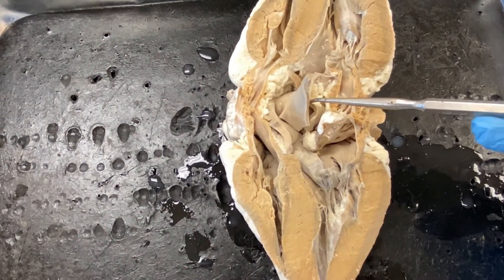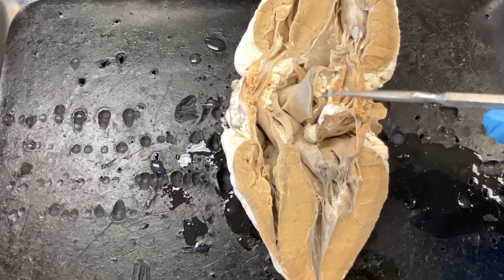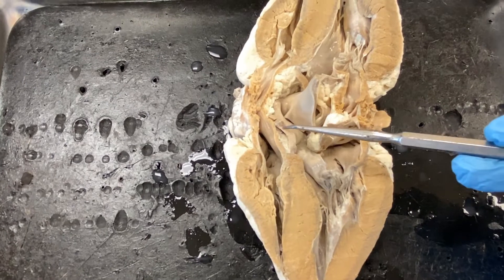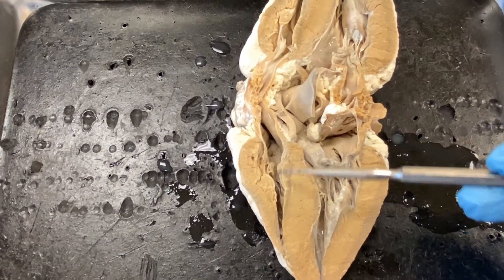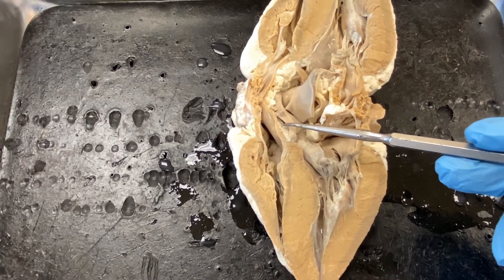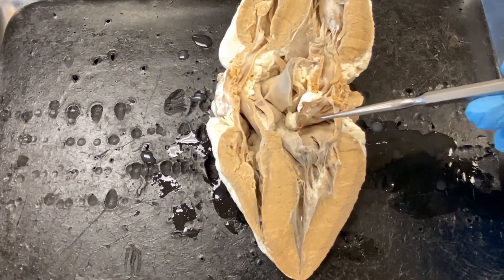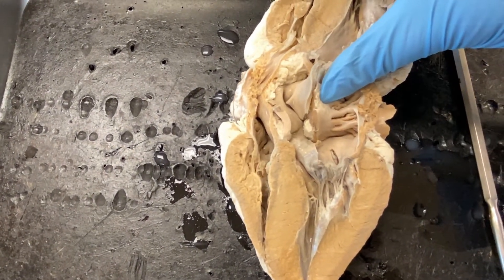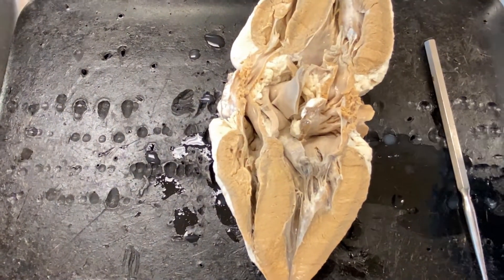At the junction of the aorta and the left ventricle, there will be the aortic semilunar valve. Here is the pulmonary artery — at the junction of the pulmonary artery and the right ventricle, there will be the pulmonary semilunar valve. We can also see the pectinate muscles, the beautiful pectinate muscles in the atrium.